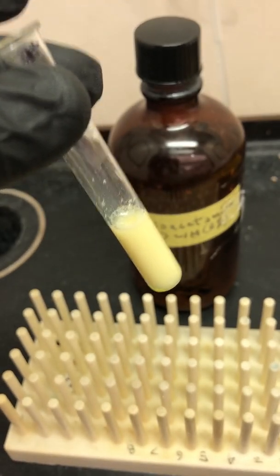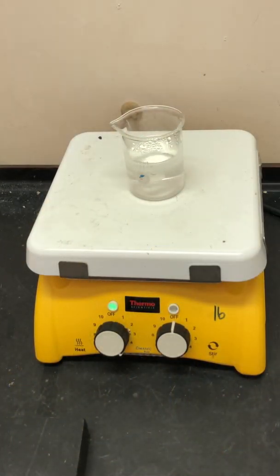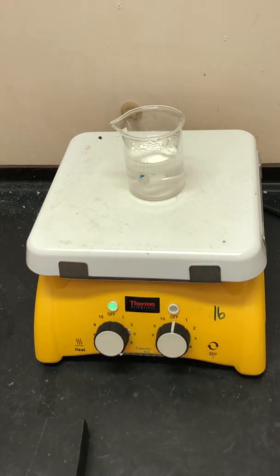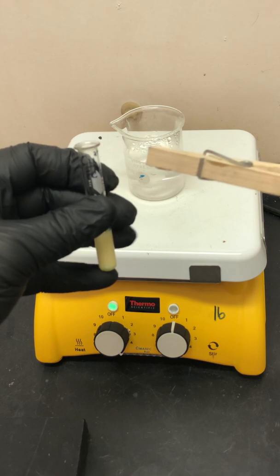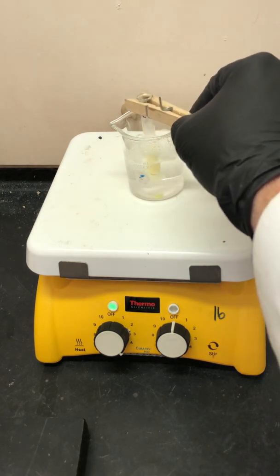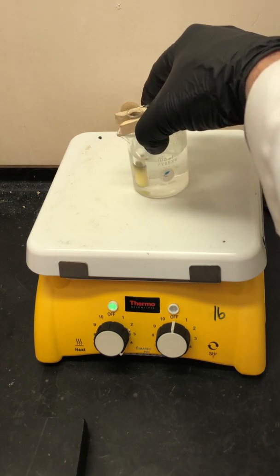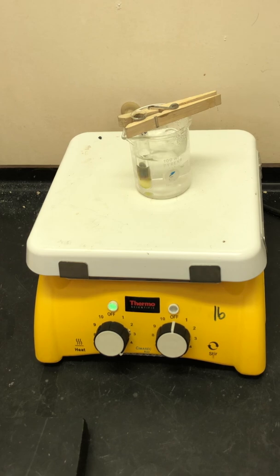Now what I'm going to do is put it in a boiling water bath. Here is my boiling water bath — I have it in a 100 milliliter beaker. I don't want it to be boiling so hard it's splashing all over; I want a gentle boil. I can't just simply dip my test tube in there because it might jump up with the boiling action. So I'm going to use a clothespin, grab the test tube by the top, and let the clothespin span the width of the beaker so the test tube rests in there. It's starting to turn dark, so I'm going to let it heat in the boiling water bath for about five minutes.